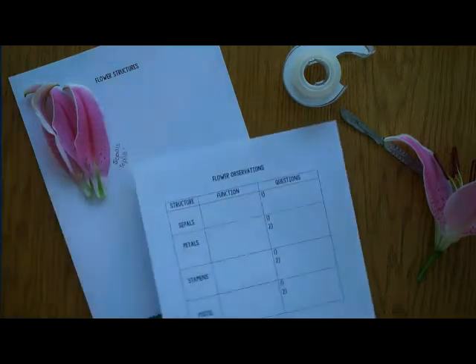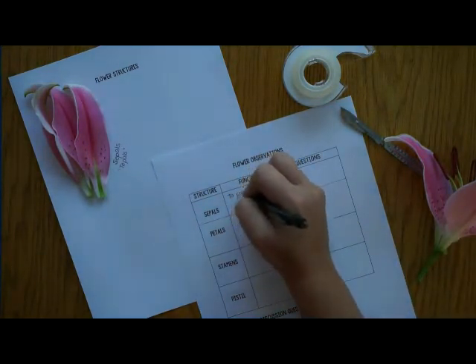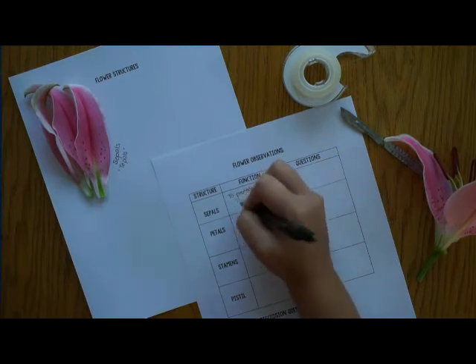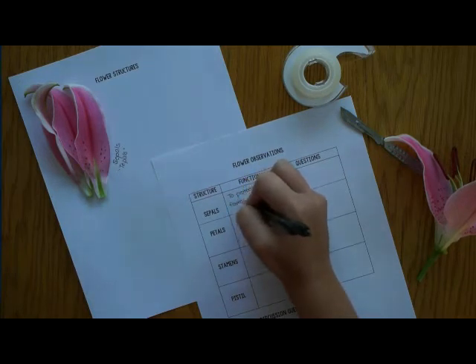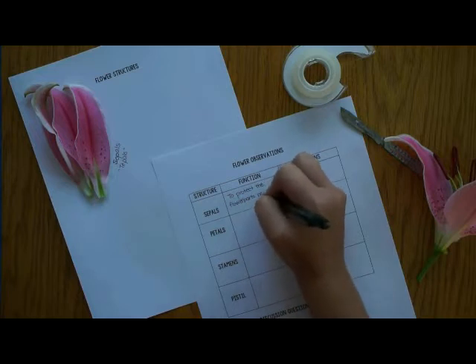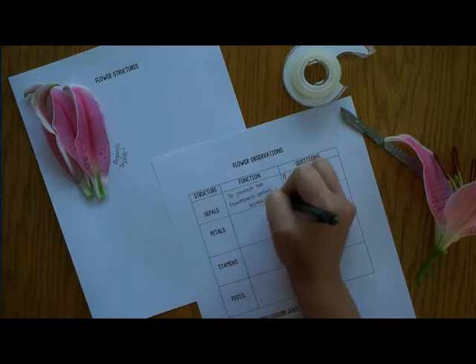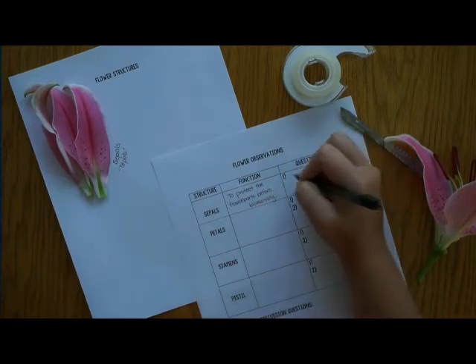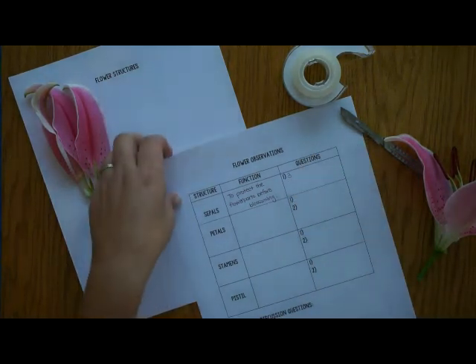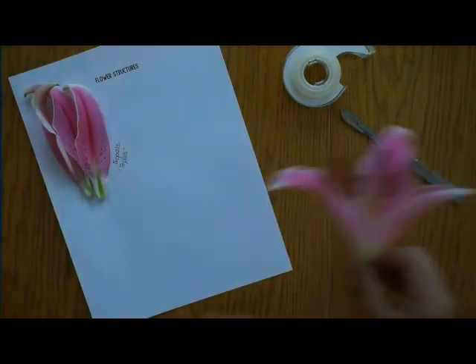You should read what the function of a sepal is and all of your structures, then record that function on your flower observation page. It will also ask you questions throughout the procedure, and you can write the answers in the right-hand column of your observation page. The question for this step was: how many sepals does your flower have? My answer is three — yours might be a little different. You should have that whole page filled out as you go.